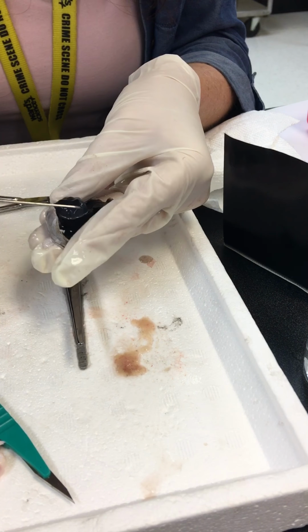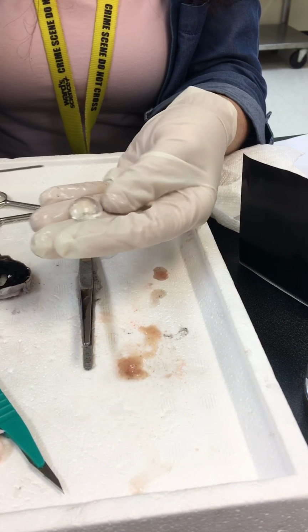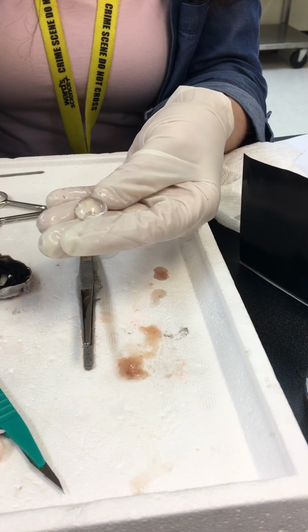This is very soft, very pliable. I could squeeze this with my fingers and destroy it. But you see how clear this is? See how clear that is? Now, it's not like a liquid. I mean, it's not like I could poke it and the liquid would come out. This is layers and layers of just clear tissue, okay? So if you were to cut through it, you would probably see layers much like an onion. Concentric layers, yeah, in here.